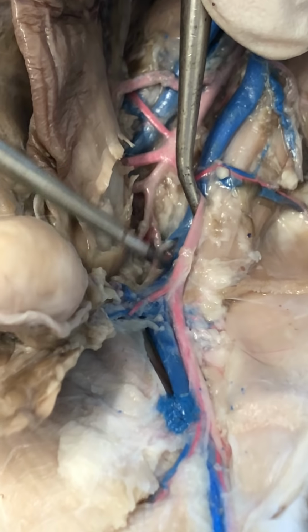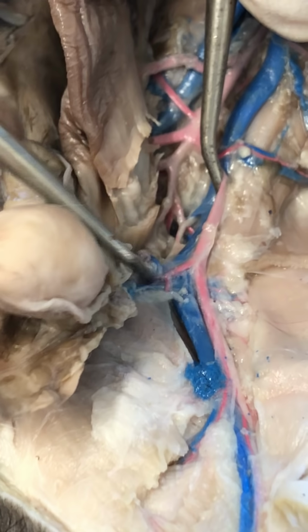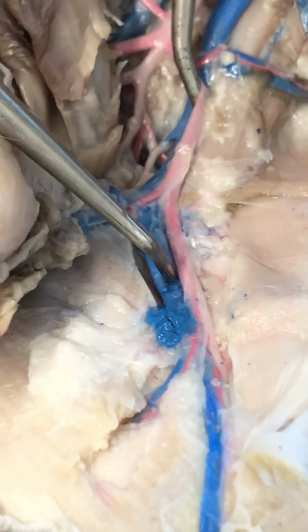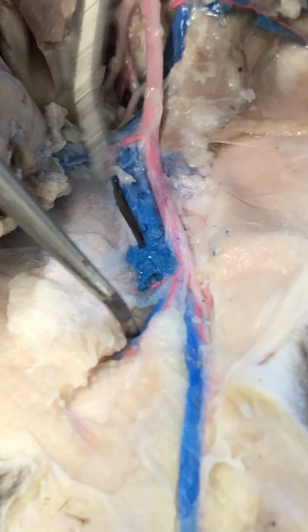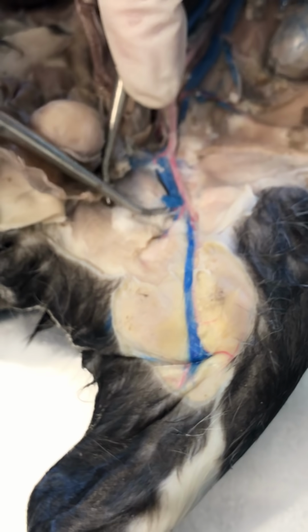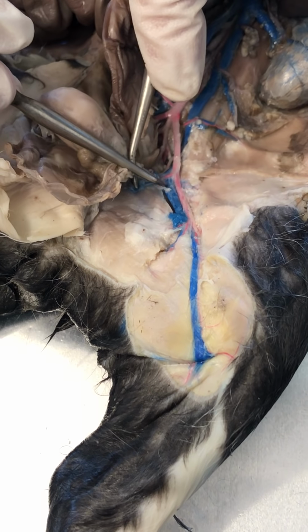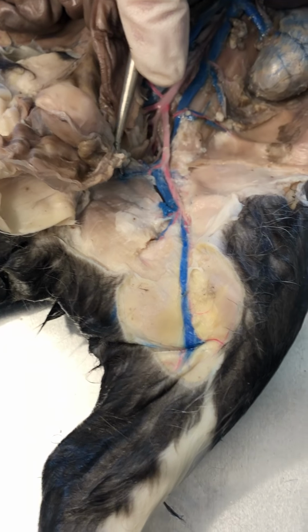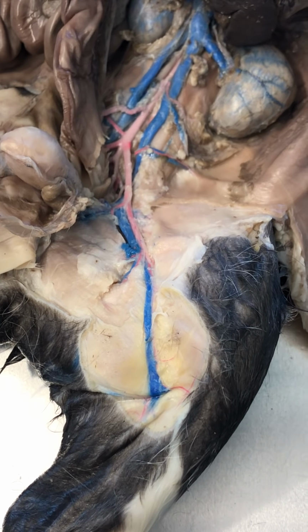Okay. So right here will be my deep femoral vein. So then my external iliac becomes femoral vein. Okay. Then right here is a branch we don't need to know, but just know it's the caudal femoral. Okay. But know that after this branch, my femoral vein is now greater saphenous continuing down the leg. Okay. So that's it.